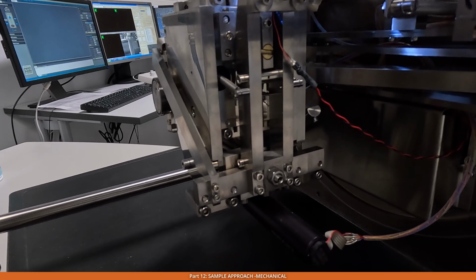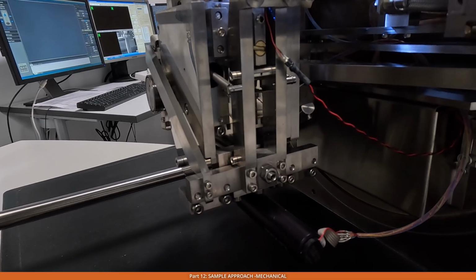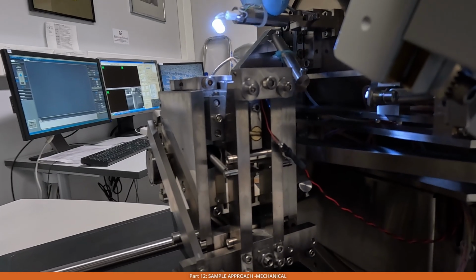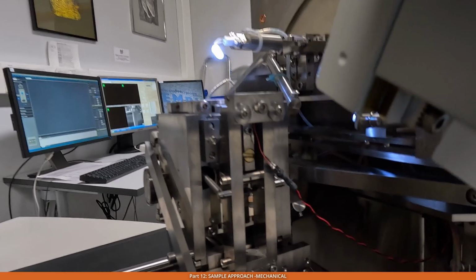The easiest way is to make sure that the sample is coated, because when it's coated it really reflects the light pretty well. And also you can play around with this LED by moving it into different directions to make sure that the shadow, or this kind of band of light under the knife, is properly visible.